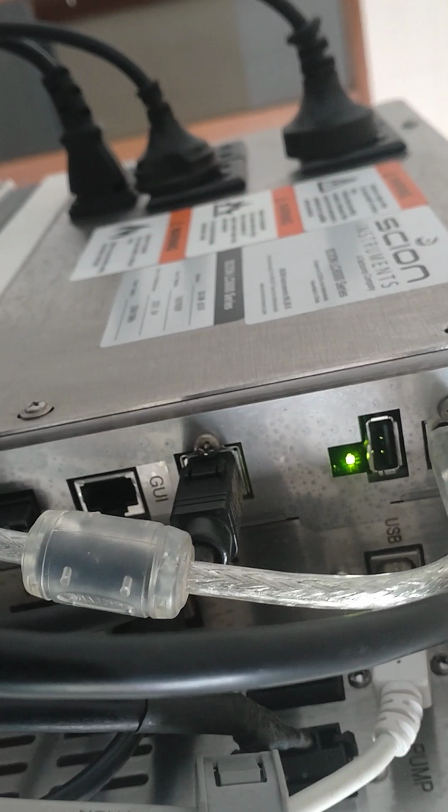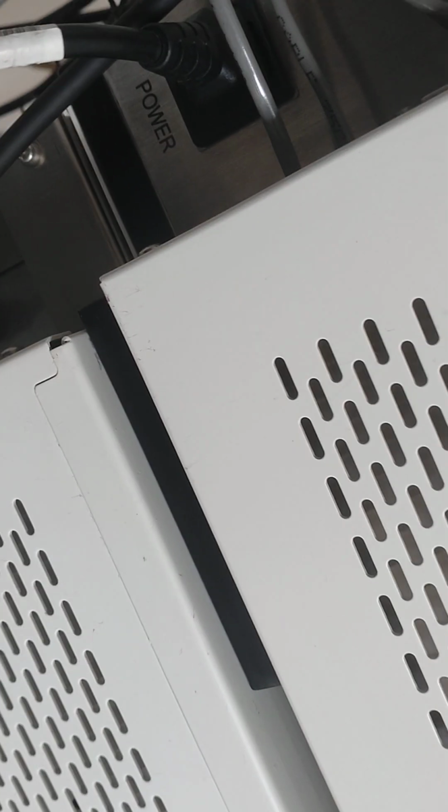Then we also have the other cables that are connected. For example, this channel comes and goes straight to this column, and again from another one from this column for channel 2. Channel 2 comes to this channel 1 from the detector. Then for the pump there is a connection from the organizer here to this pump 01. This goes directly to the organizer, and this one goes straight also to the organizer.